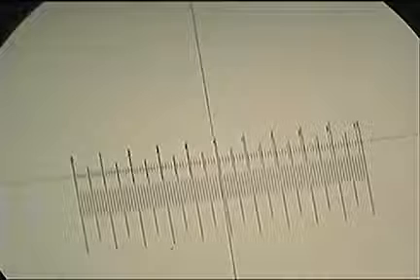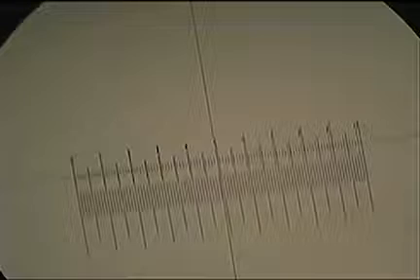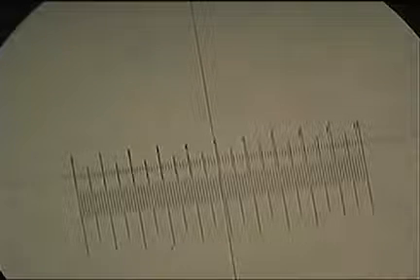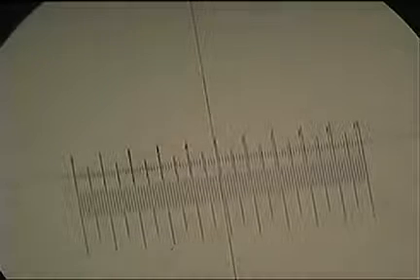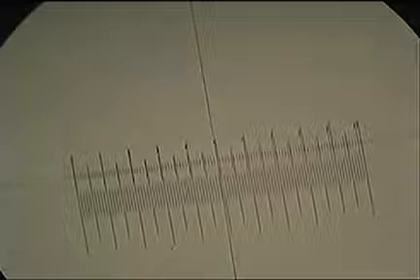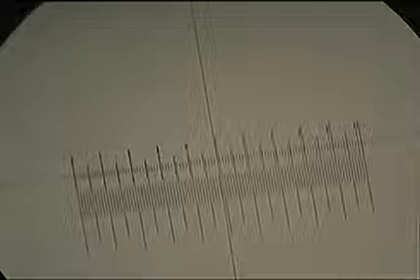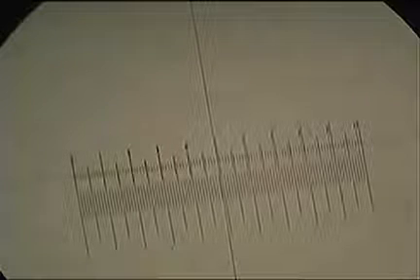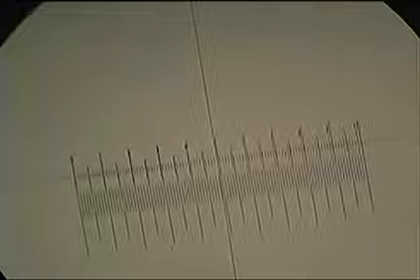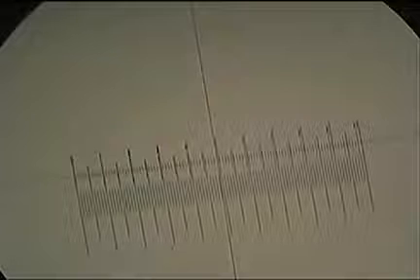Fantastic. So to work out what the size of each unit on the eyepiece is, we take the distance on the stage micrometer that we've measured, and we divide it by the number of units on the eyepiece graticule at that distance. So it was our 0.95 millimeters divided by 9.6. That means each unit on the eyepiece graticule, from the 0 to the 1 on that top scale, is equivalent to 0.099 millimeters, so just under 0.1 millimeters. Now we can use the eyepiece graticule to measure cells, but we have to remember this is only at this magnification.